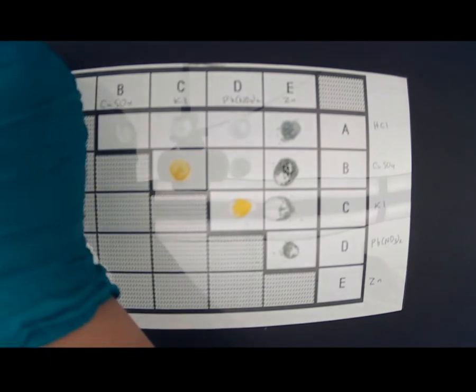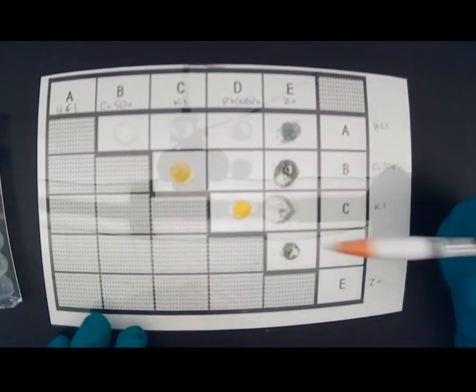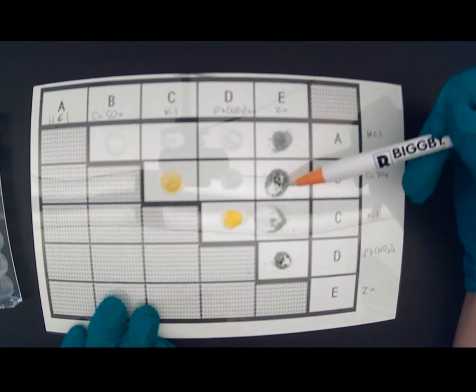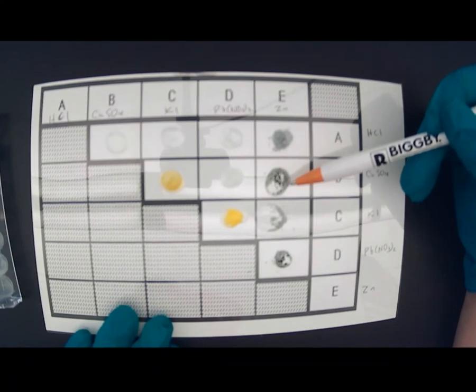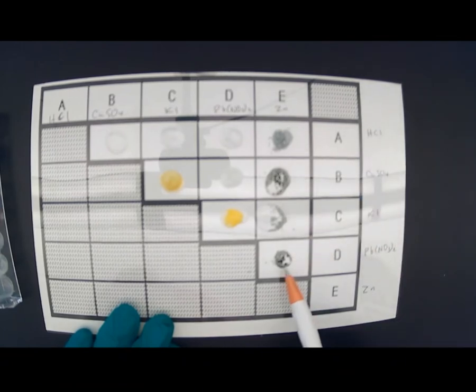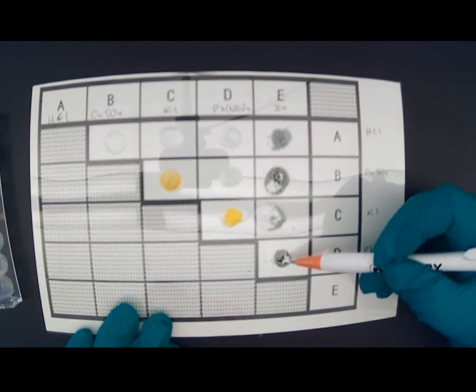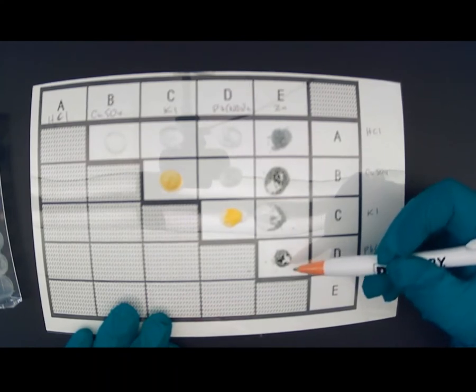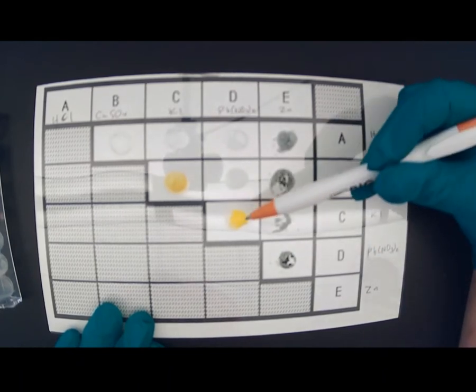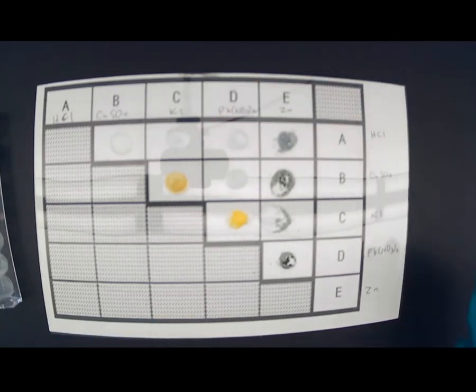Let's see what's going on here. There's actually bubbling happening here. The part that actually sunk inside the droplet turned black. Nothing much is happening in this one. This one also — the one that has sunk in is black. And if you actually look very carefully, there are actually crystals forming inside — the particles look kind of fuzzy because there are tiny little crystals forming. You see yellow here, and this also turned kind of a brownish color.